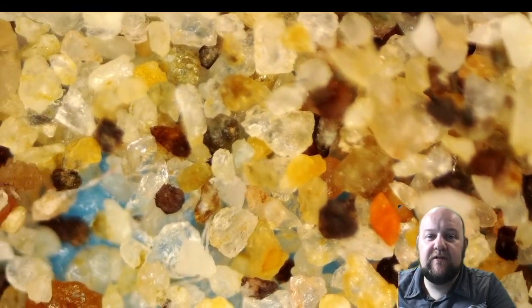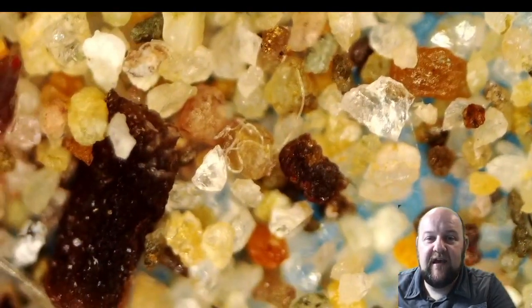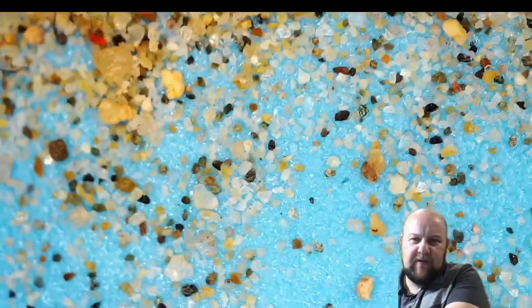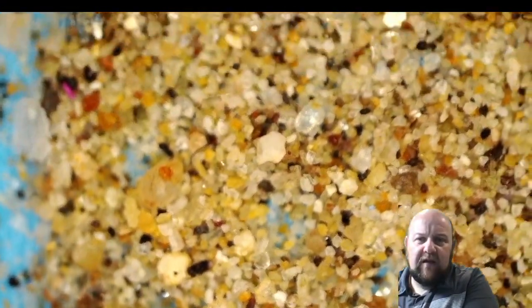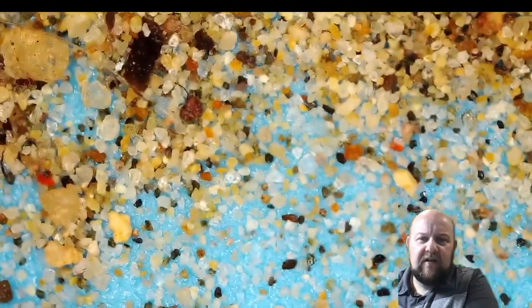Anyway, very colorful, lots of little variations there. I like the clear ones there. It's like little glass, and then some dark. It's peppered in, almost looks like pepper down here, especially if we zoom out. This is 40 times zoom, and it almost looks like it's some kind of pepper, like right down here. Yeah, it looks like pepper. Very interesting as you look at all the interesting grains of sand.